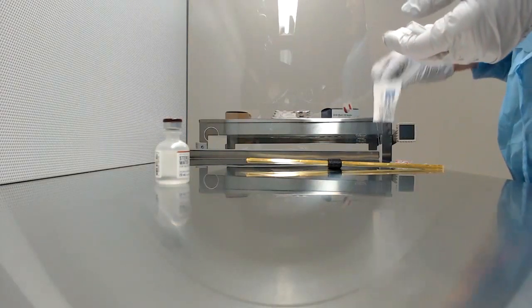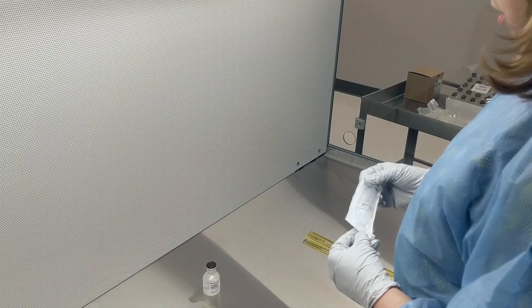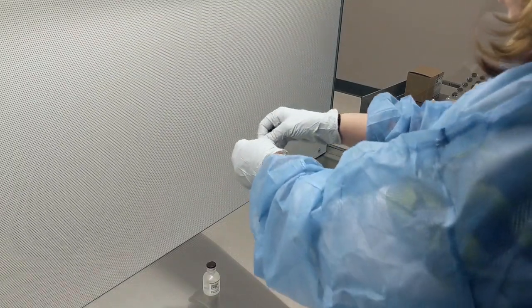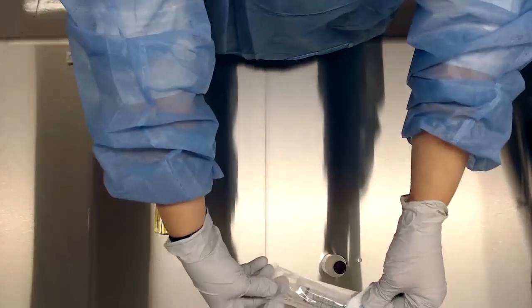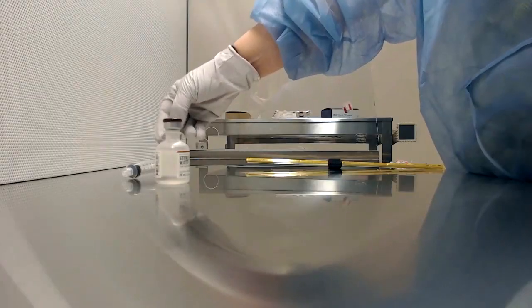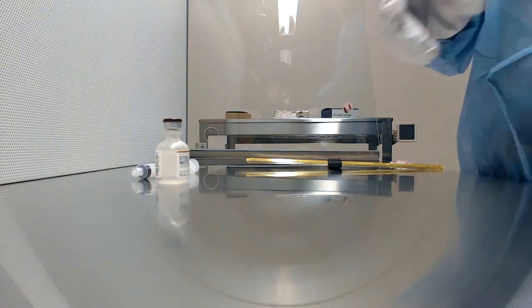Then I want to put my syringe in there, but I don't want this outside wrapper in there. So I'm going to hold it up into the sterile area and just dump the syringe in, or you can pull it out because your gloves are sterile and place it in there.